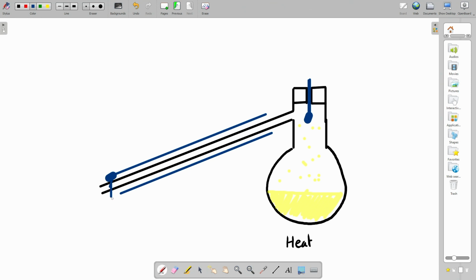Here, I didn't press the right button. Yeah, it's all gone wrong. There we go. Water going in, and then at the top, we've got water going out. So the water comes in here, rushes up this way, surrounding that tube, cooling this gas, and as it meets the cold surface, it gets colder and colder, and it turns to a liquid, and then we collect it coming out of the condenser, and we collect this in something like a conical flask.